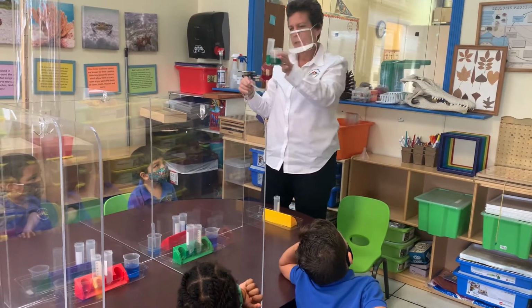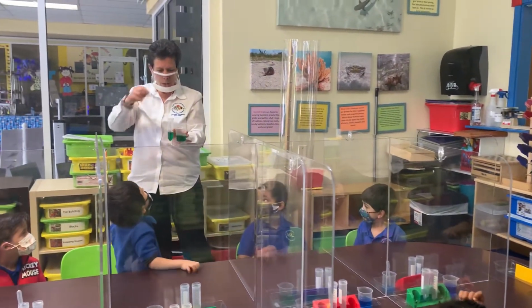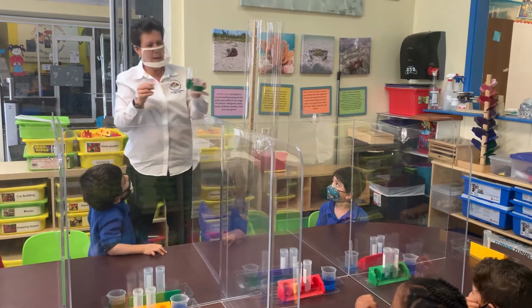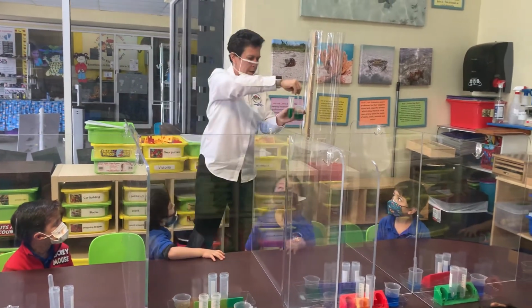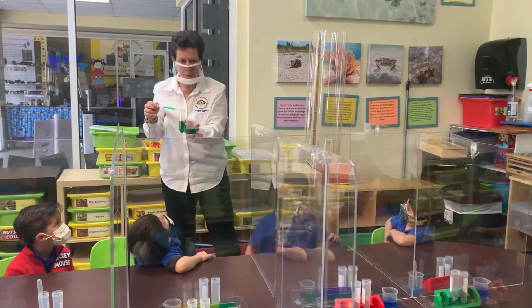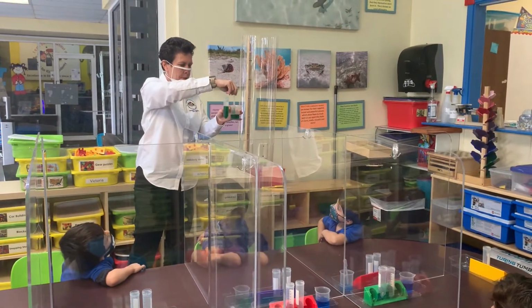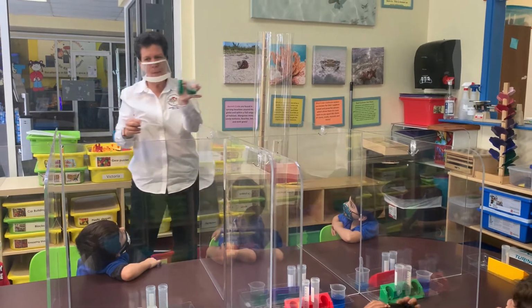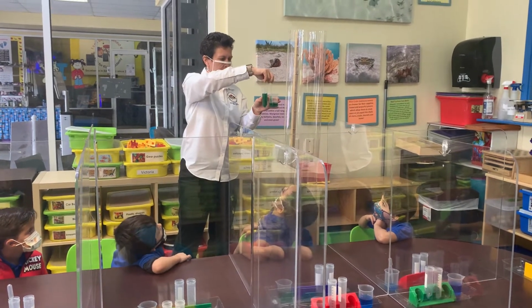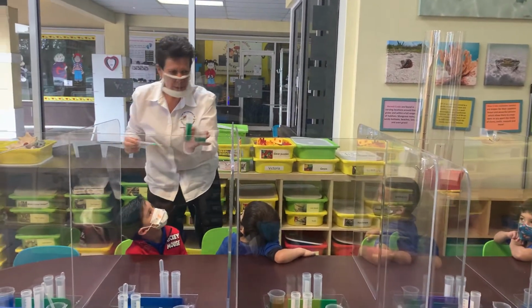Stop. Okay, let's see. Am I at 35 yet? No. Not yet. Almost. Okay, so let me keep going here. Stop. Let me see. Am I at 35 yet? No? Okay, let me keep going. Stop. Right now I'm at the 2 and the 5. What is a 2 and a 5? 25. So we want to keep going to 35. Stop. Let's see. Right now I'm at the 3 and the 0. Is that 35? No. Oh, but we're getting close, right? Stop. Let me see. Stop. Are we at the 35? Yes. Okay, we're at the 3 and the 5.